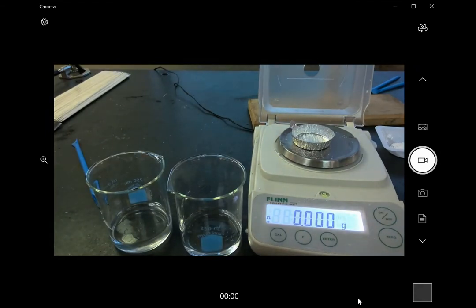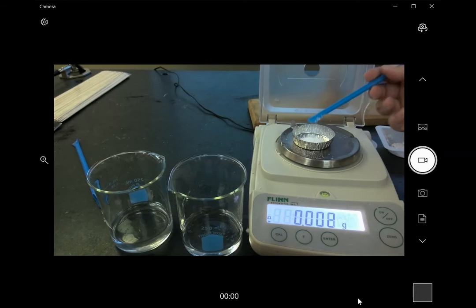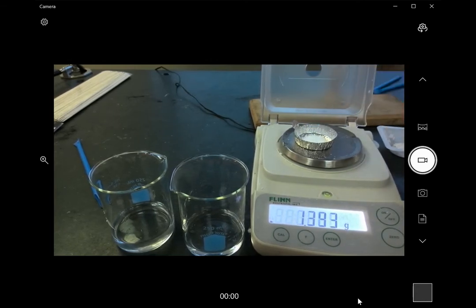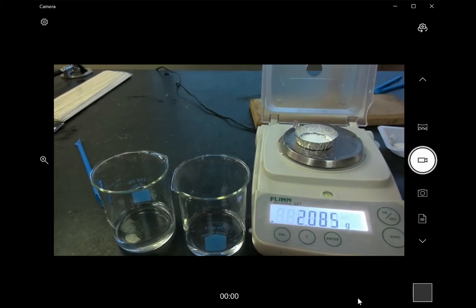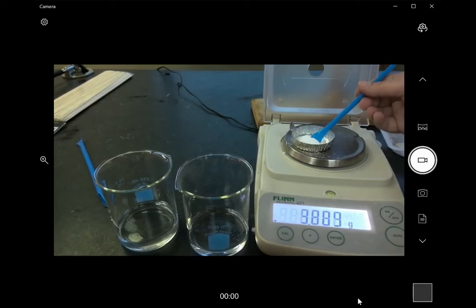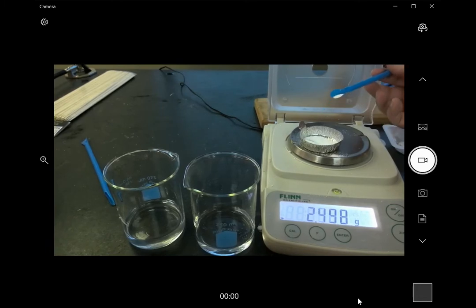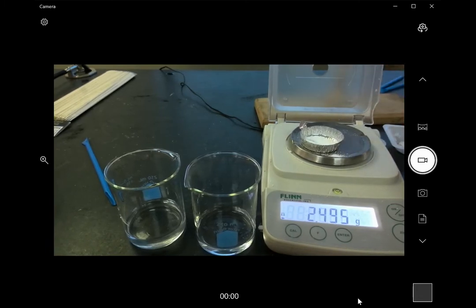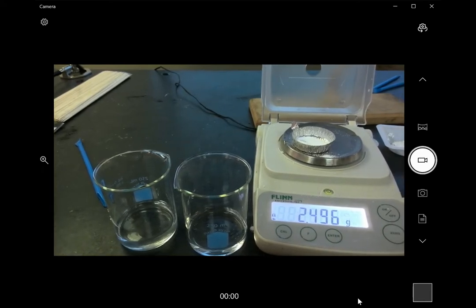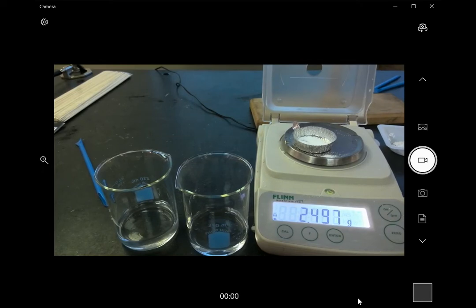I'll start with the sodium carbonate, and I need 2.50 grams of that. All right, so that reads 2.496, which is fine because I only need three significant digits, and that would round to 2.50, so I'm going to leave it right there.